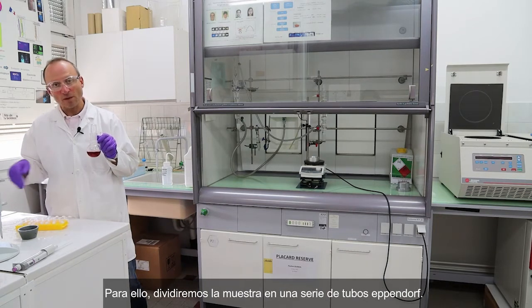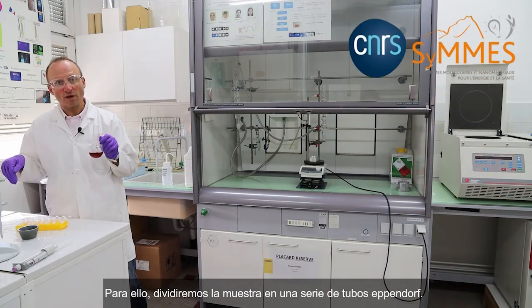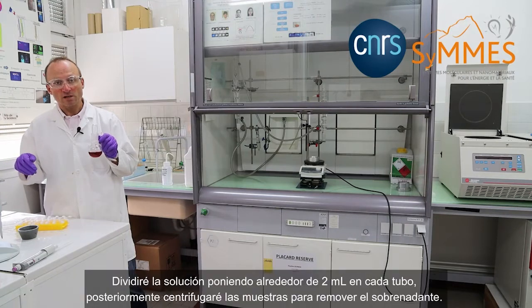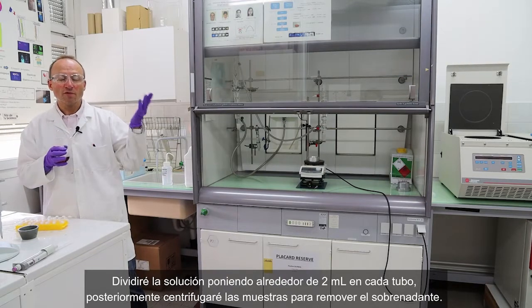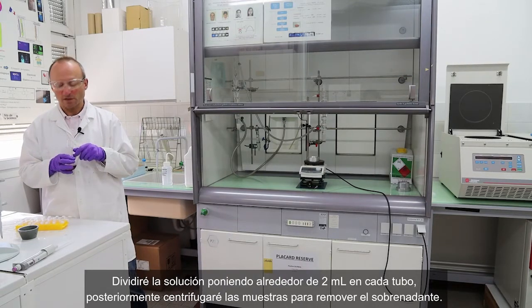So I will split the sample into a series of Eppendorf tubes. I will split about 2 milliliters in each of them, and then I will centrifuge the samples to remove, after that, the supernatants.